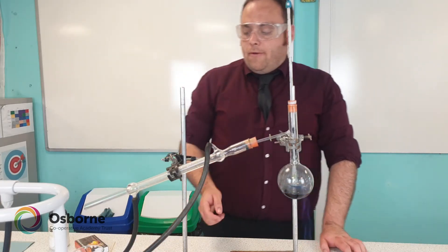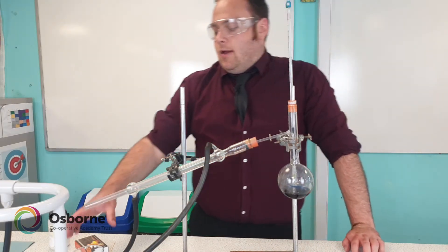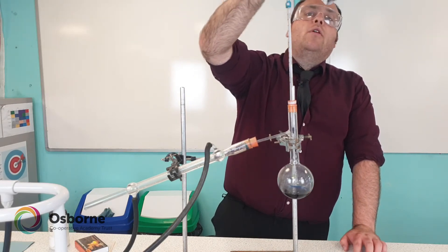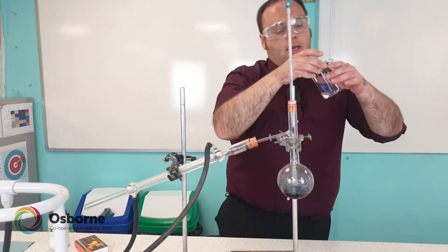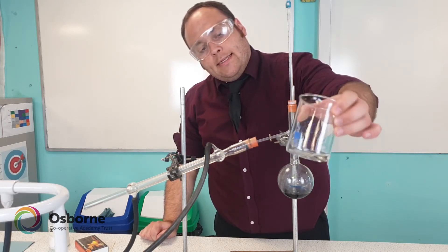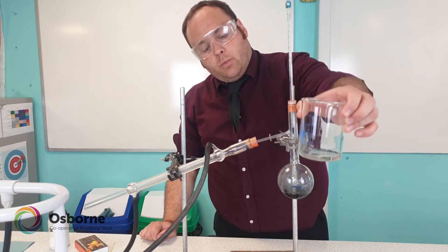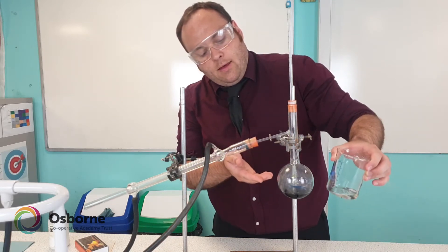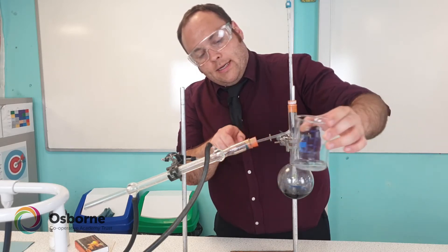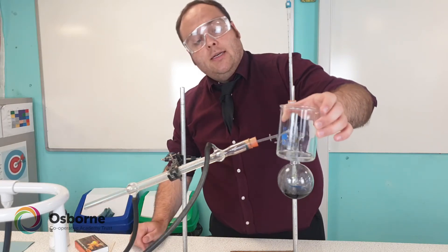We seem to have made quite a bit of water, so I'll turn the Bunsen off now. If I show you what was collected in the beaker — we've got colourless water here, and that's how we know we've been successful in separating the ink and water mixture. This water was once with the ink, then we boiled it, it came up, went down the condenser condensing, and then dripped down as colourless water.